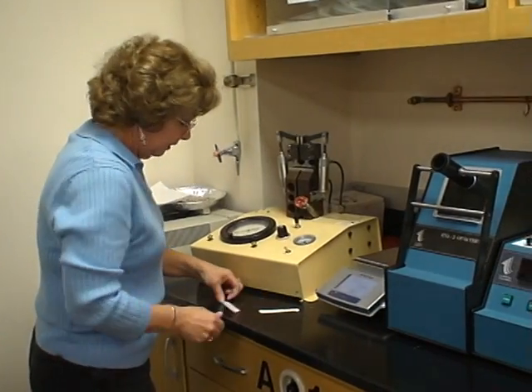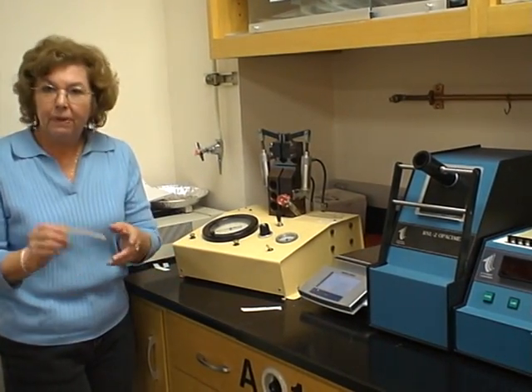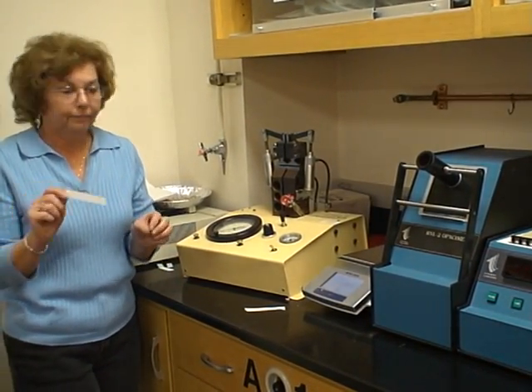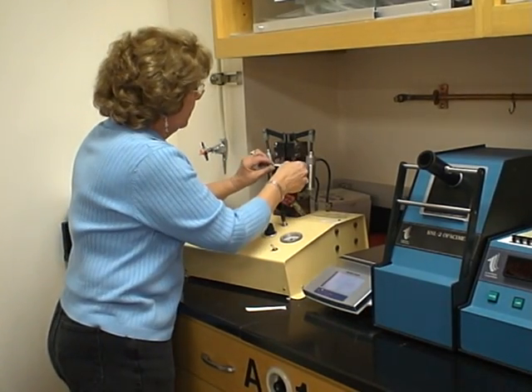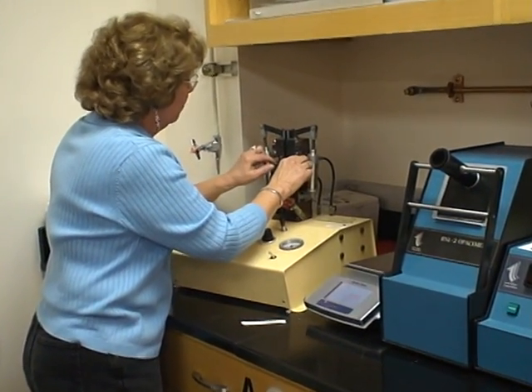Our sample size is 15 millimeters and it's about 3 inches long. What we're going to do is slide it in underneath the clamp so it goes all the way to the back.